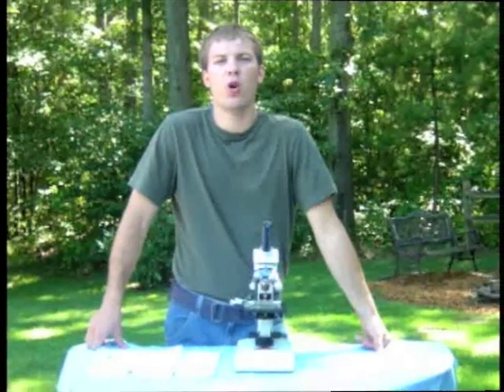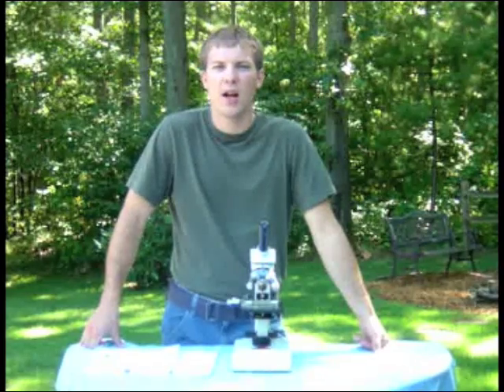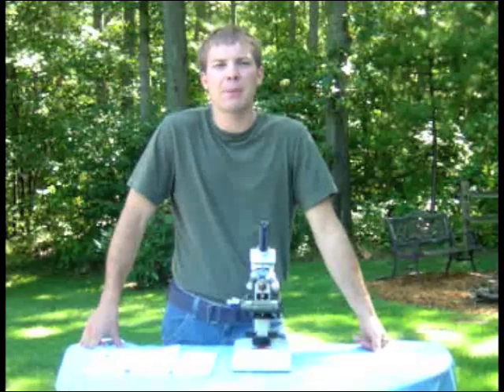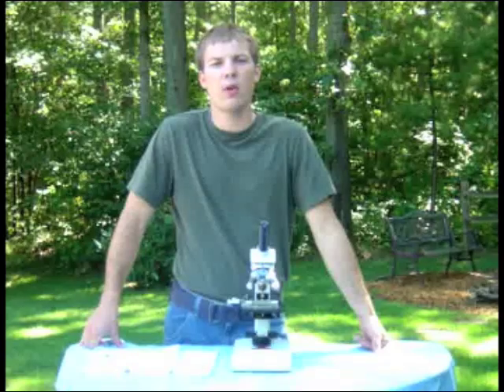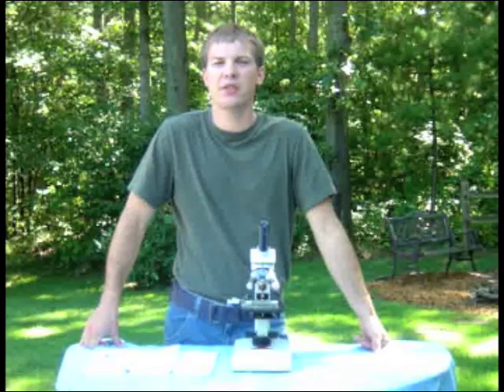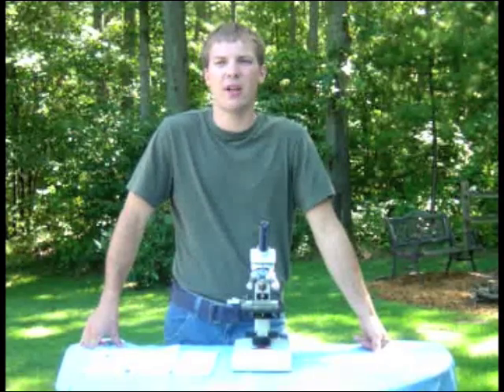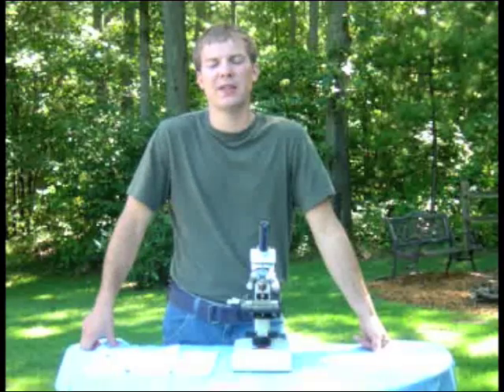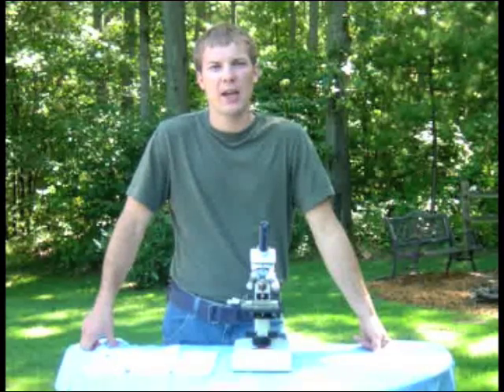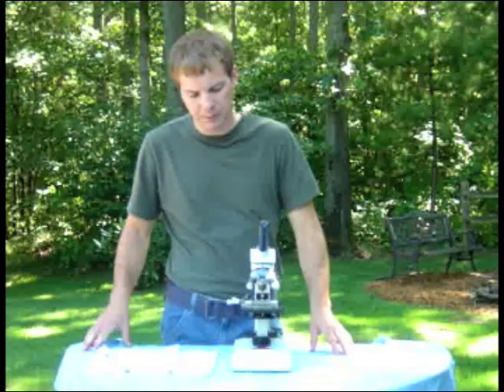Now let's talk about total magnification. On many of the labs that we'll be doing this year, one of the questions that you'll need to answer is: what is the total magnification under which you viewed your specimen? And to figure that out, it's very simple.